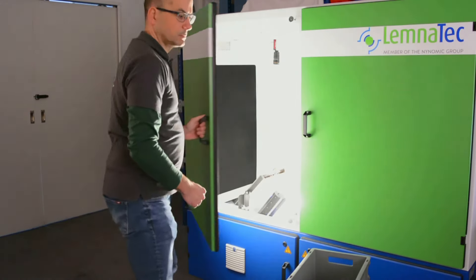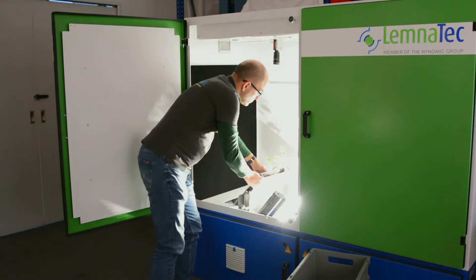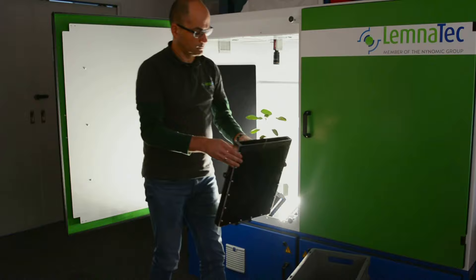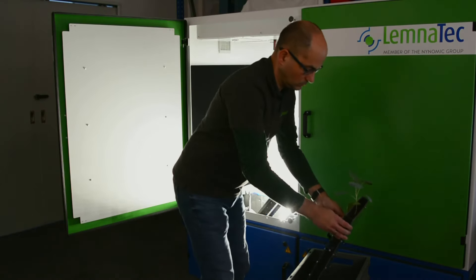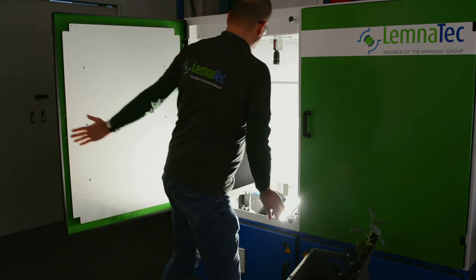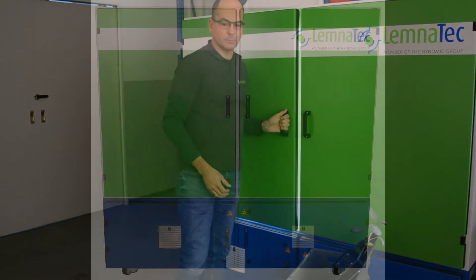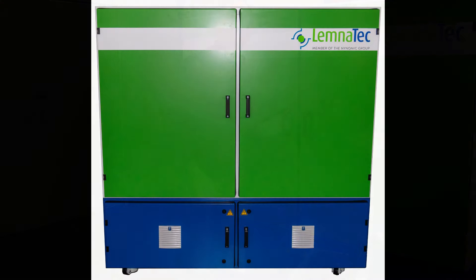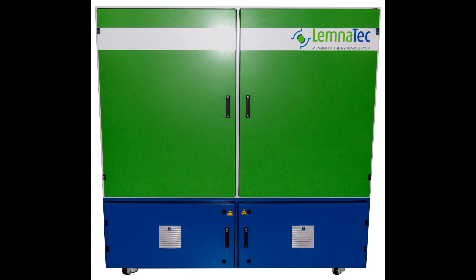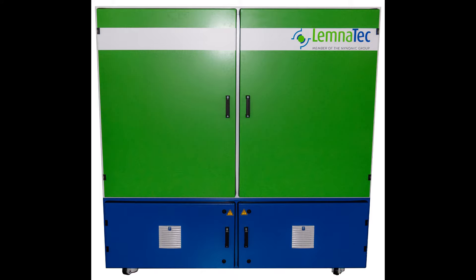After imaging, remove the Rhizotron from the cabinet. The system is now ready for the next sample. The next sample can be recorded with the same configuration, or a new configuration can be set up.